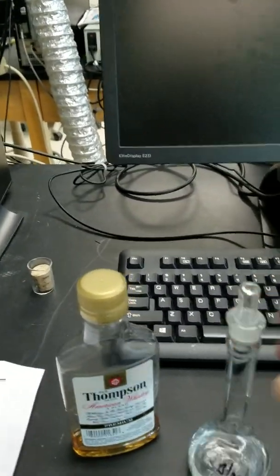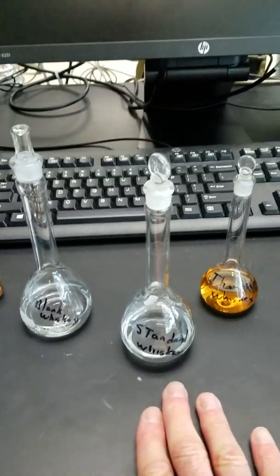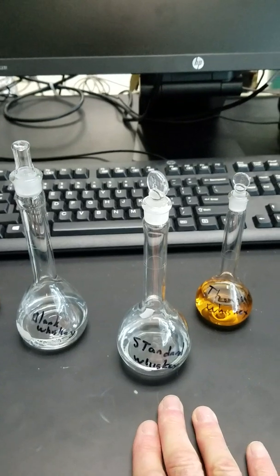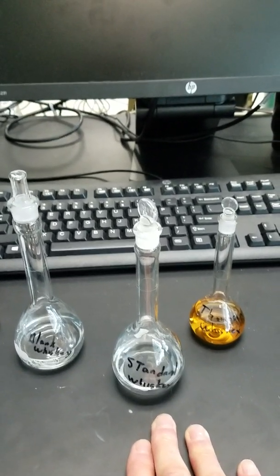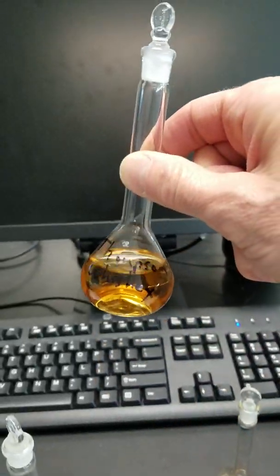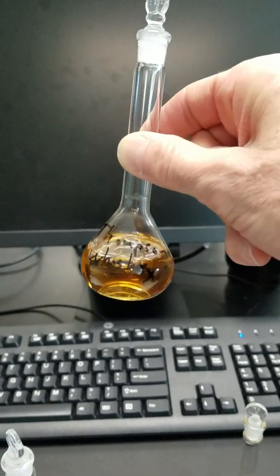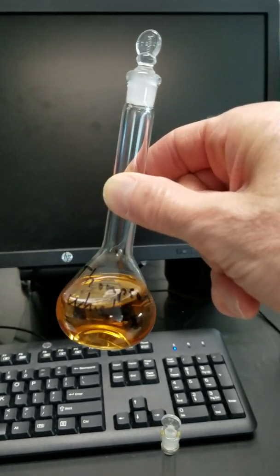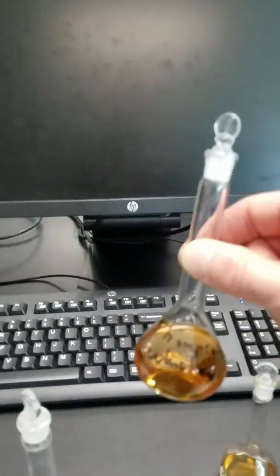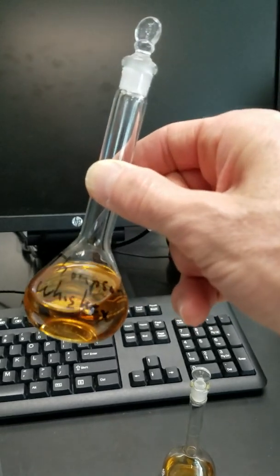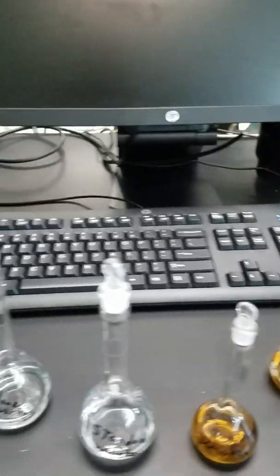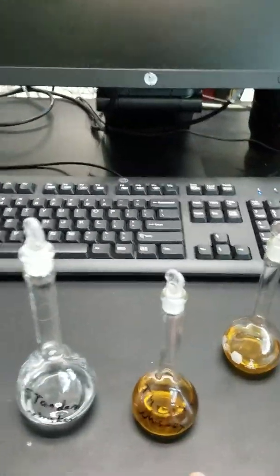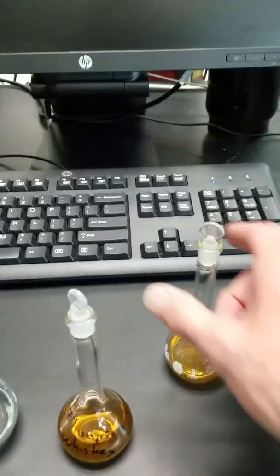We have a standard that is 40% ethanol, 60% water, with all of the analytes added plus the internal standard. Then we have the Thompson whiskey, which is just whiskey sample plus the internal standard. If there's analytes there, we should be able to detect them. The Thompson whiskey is 80 proof, 40% ethanol and 60% water. The matrix of our standards matches the sample, and that's very purposeful.